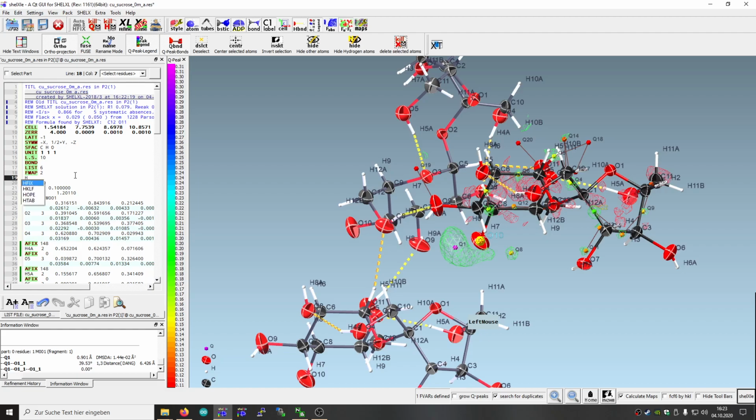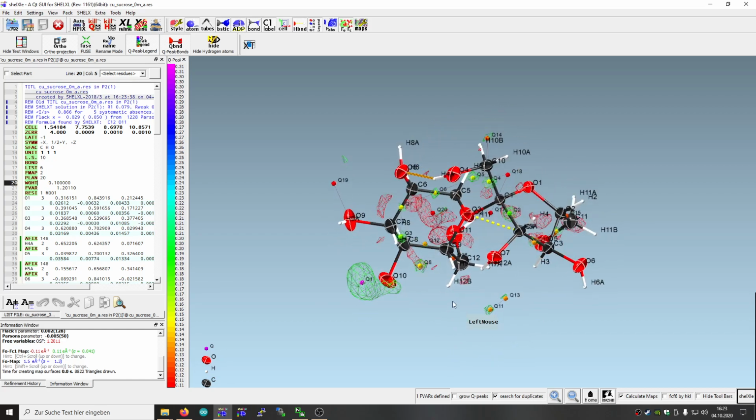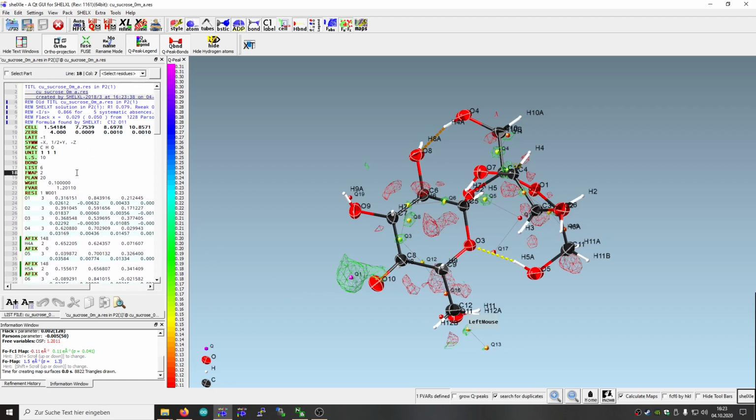So we just say HFIX and 148 for having a hydroxyl hydrogen there, which is able to freely rotate according to the density, and we have to specify which atom this is, and it's O10. So just say O10, and we just refine that. Oops, why did that not work? I don't know. Let's repeat that.